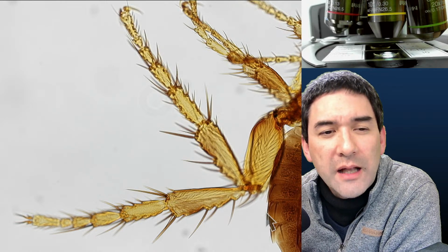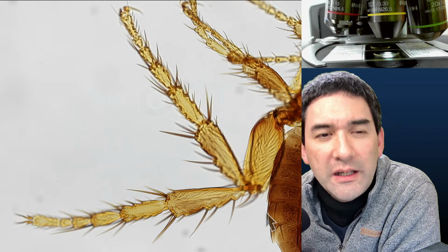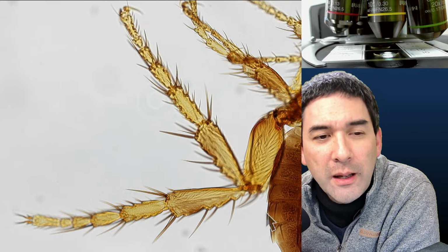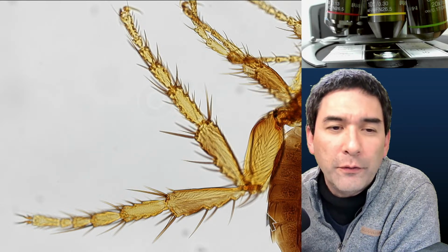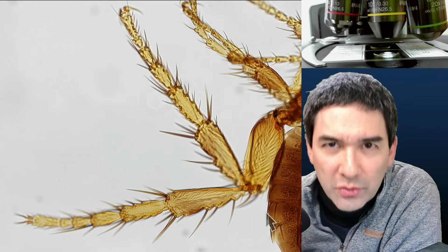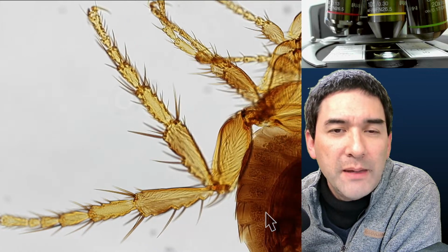So those spikes will actually go into the ground, because it's not just jumping off with a foot, but putting the whole lower leg into the ground and pushing itself off. They're anchoring themselves into the ground to create a lot of friction, so that it's able to jump off.